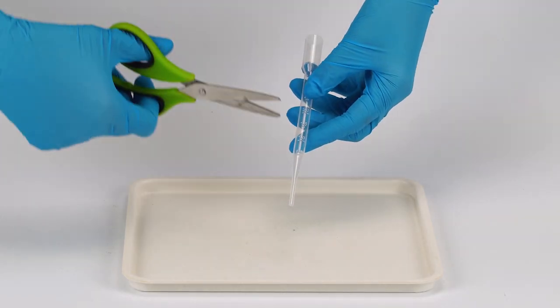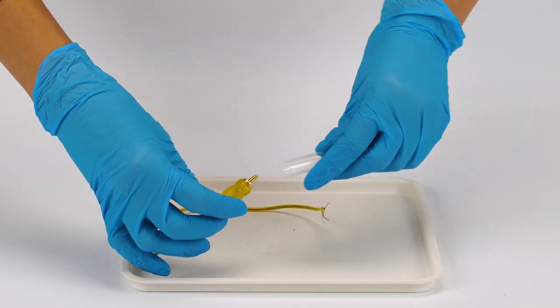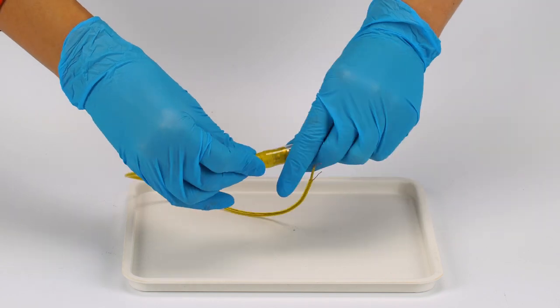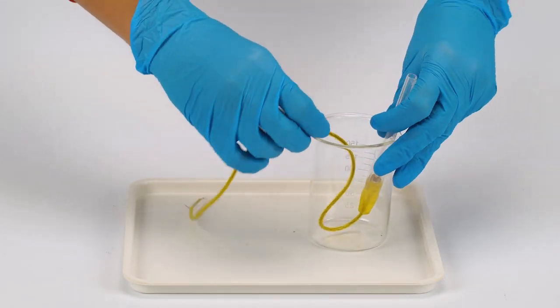Prepare the setup for water electrolysis. Cut the pipette nose at the 0.5 mark. Insert the cable plug securely into the pipette. Place the assembled electrolyzer into the glass beaker with the pipette nose up.